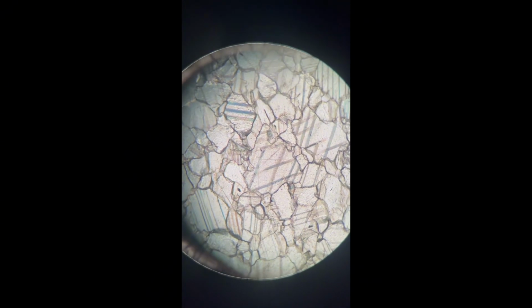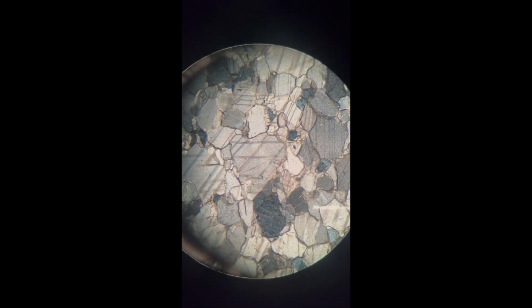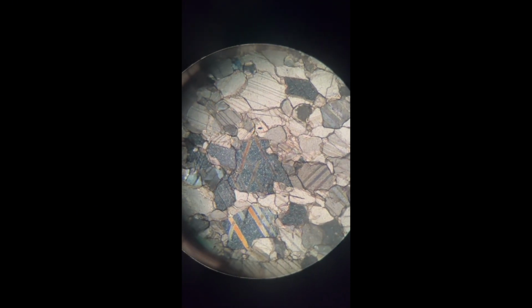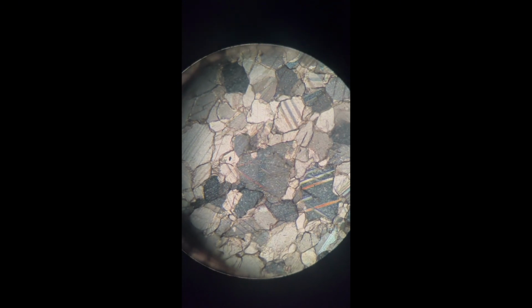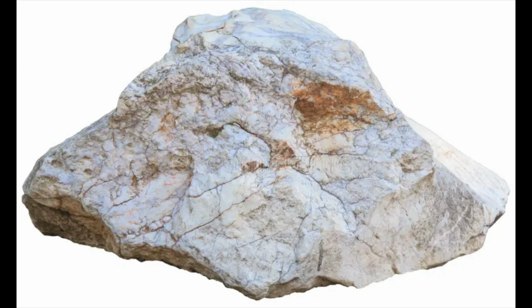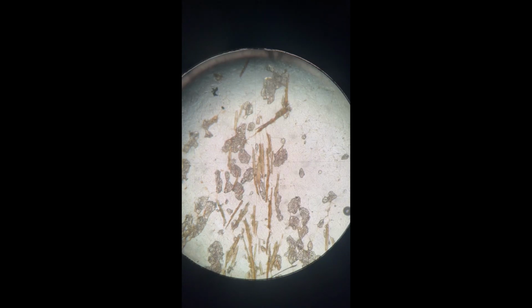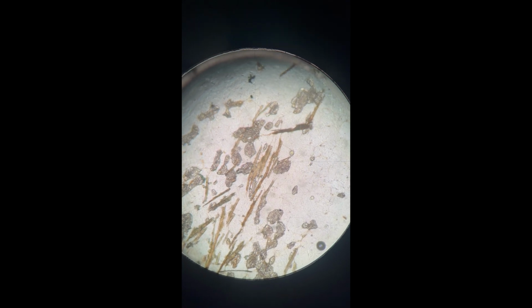However, its most distinctive feature is seen under cross-polarized light, showing off-the-chart interference colors. It also has unique birefringent properties, going extinct symmetrically. Calcite is typically associated with non-foliated textures, specifically marble, which is formed when limestone undergoes metamorphism due to high temperatures and pressure.